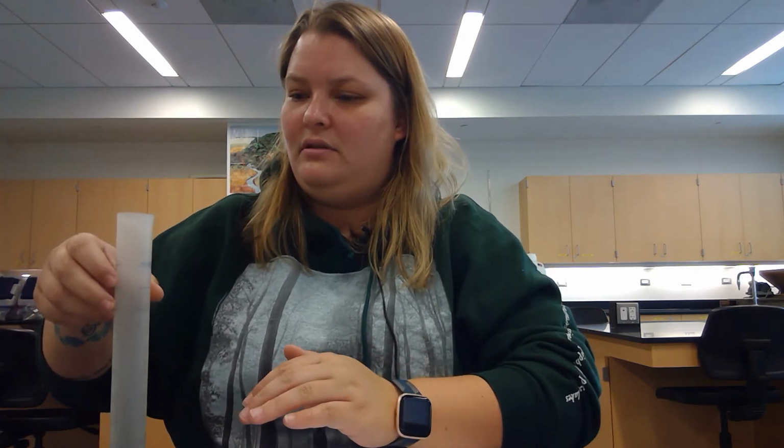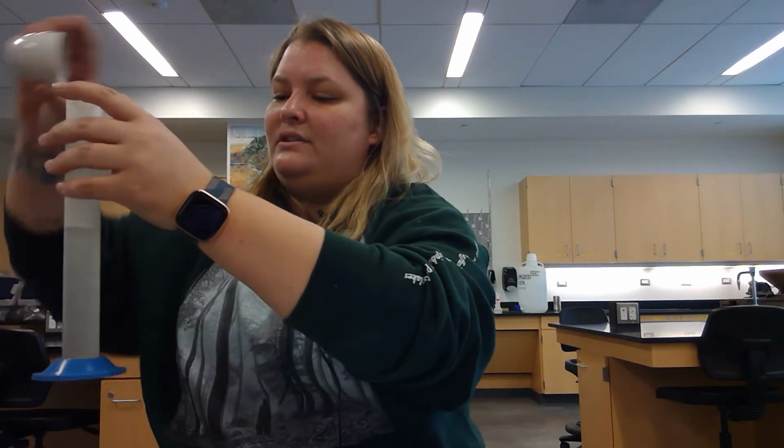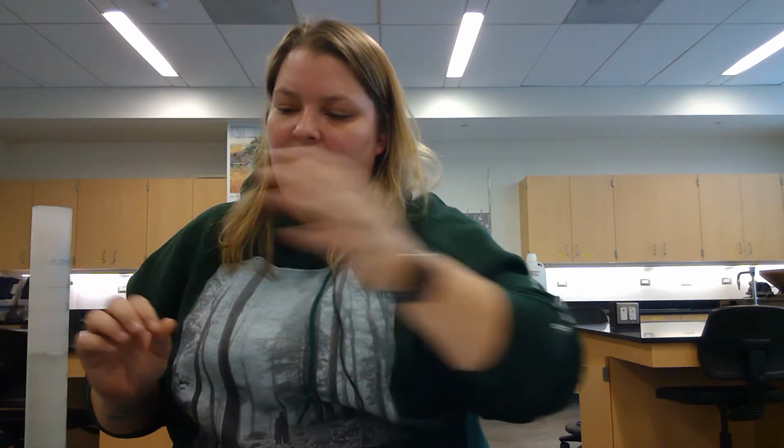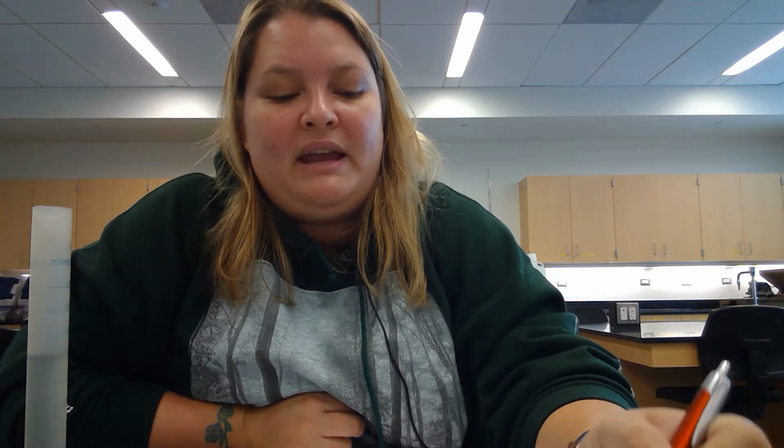So the weight of the crucible and water is 89.28. That's going to be the same across that table. I don't know how good I'll be about not spilling any of this water, but again, you could double check your work, and I did spill some of it. To get the weight of the water, you just take that measurement and minus the weight of the crucible from it. It's the same across the table, so I'm going to fill that in.